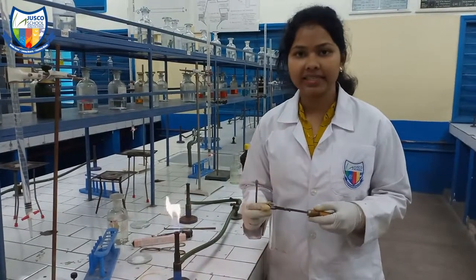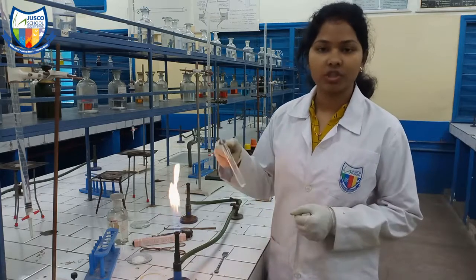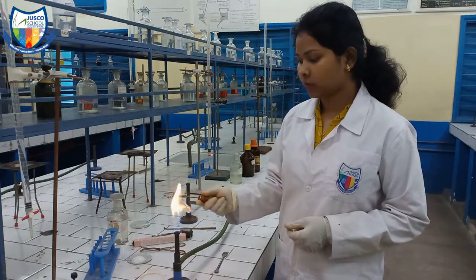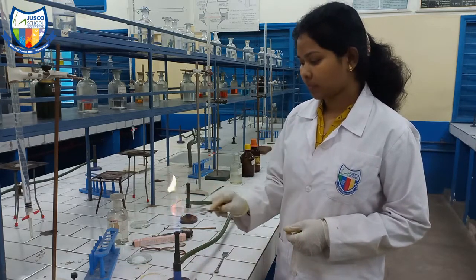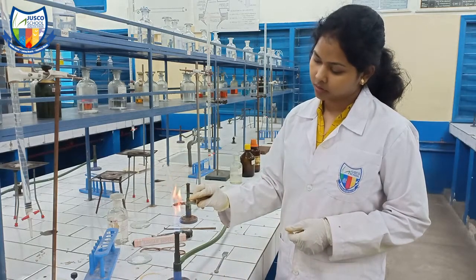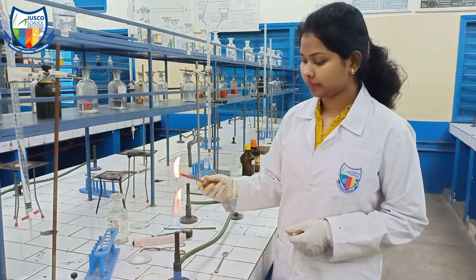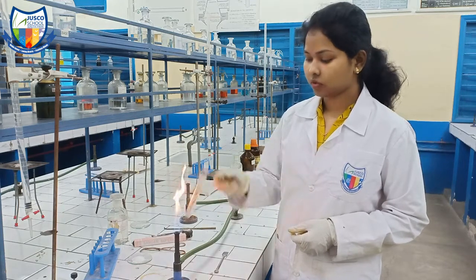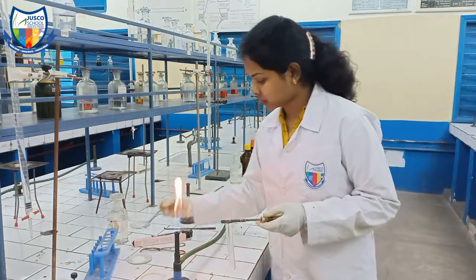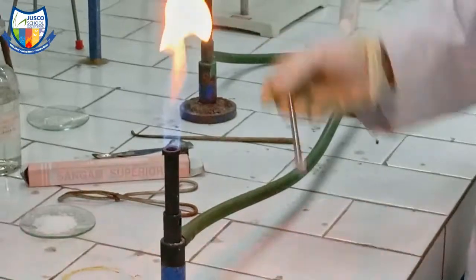Next, we will do the dry heating test. We will wash and dry the test tube by heating it gently so all the water evaporates. Now that it is totally dry, we will put a small amount of salt using a spatula and heat it.